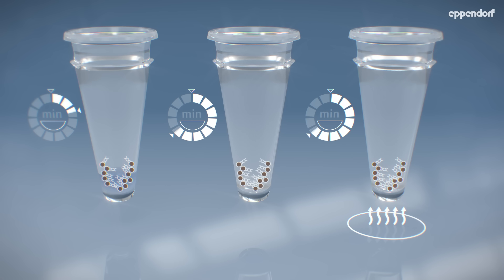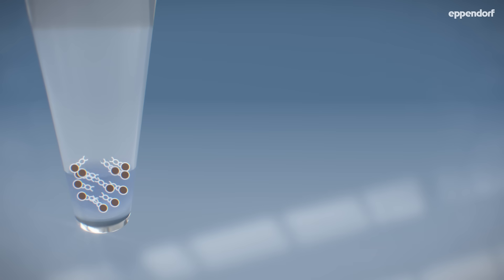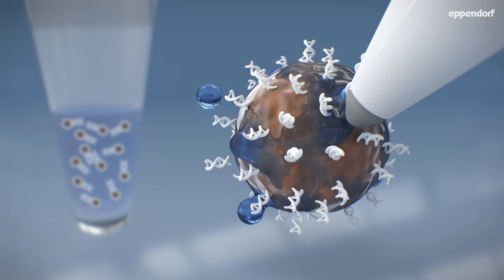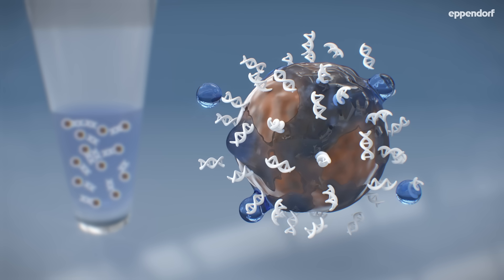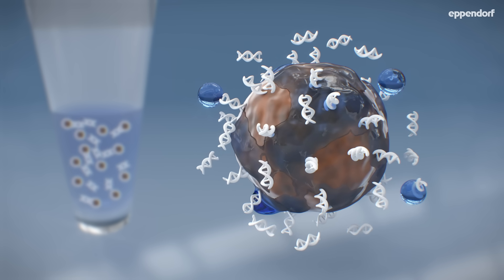Alright, let's re-suspend and elute our first pellet. After re-suspension, there is still remaining ethanol that could inhibit enzymatic reactions downstream in the NGS workflow. The pellet was too wet.